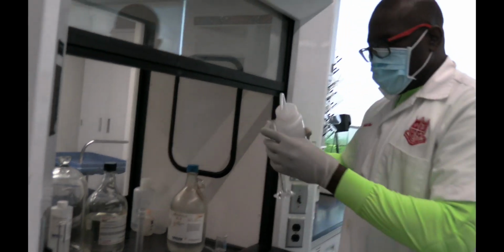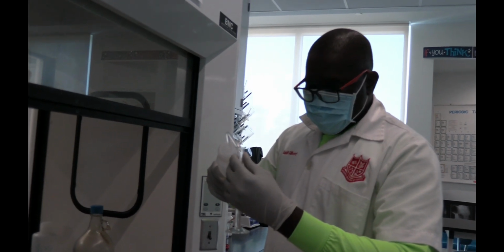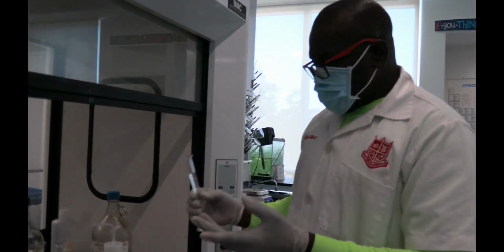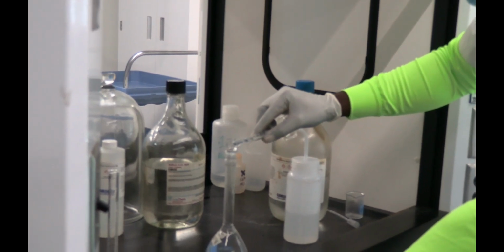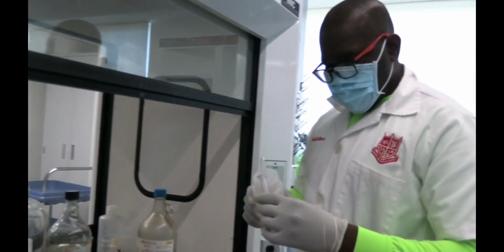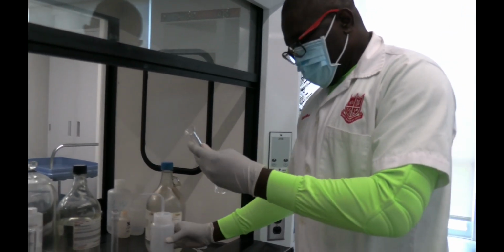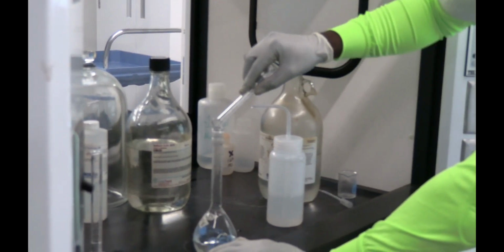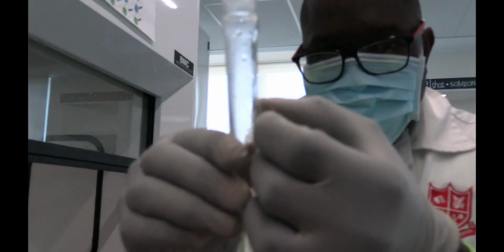Okay, so now I have my distilled water. I'm just going to rinse my measuring cylinder, and technically speaking you'd prefer to use a quantitative pipette for this, but we do not have a quantitative pipette, so we're just using the measuring cylinder to get the volume. And we add that all, we try to rinse out everything, get it down in there, just rinse it again, just to make sure that we're transferring all the acid from the pure acid solution.